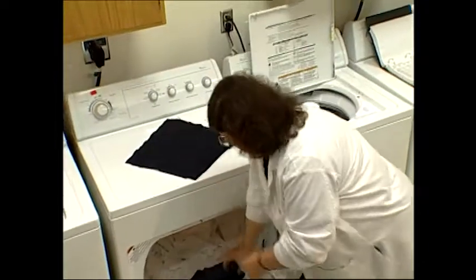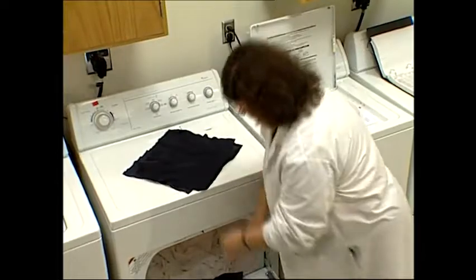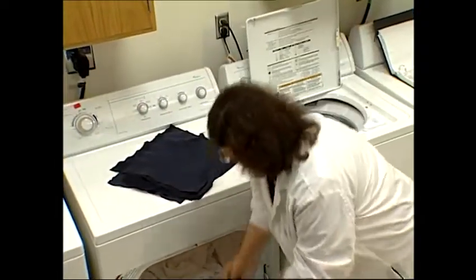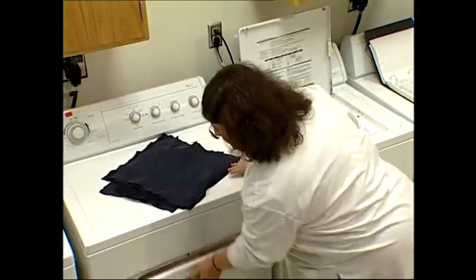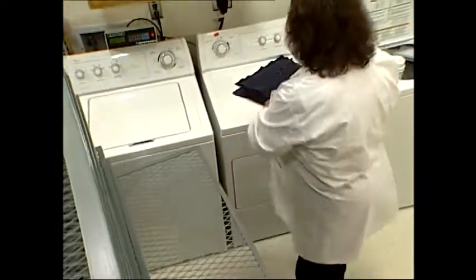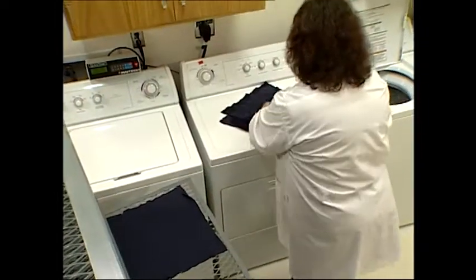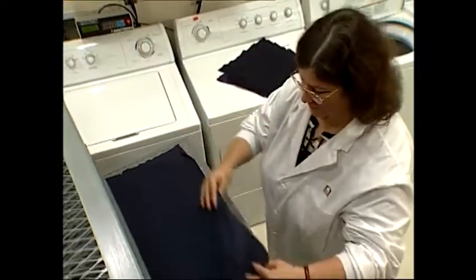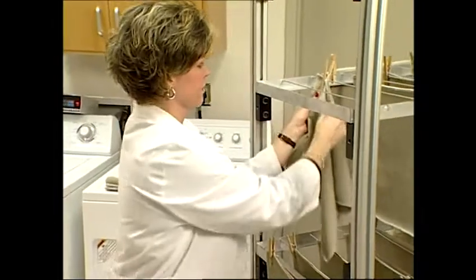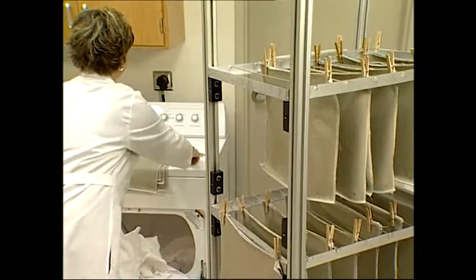One of the most important steps in measuring dimensional change is specimen handling following drying. Knitted and woven fabrics should be handled differently. Remove knitted specimens from the dryer after the final drying cycle and place them flat on a conditioning rack, as knitted fabrics are easily distorted. If knits are hung prior to measuring dimensional change, they will elongate in length, thereby falsifying the data. Remove woven specimens from the dryer and hang on the clotheslines of a portable cart, with the length direction of each specimen hung vertically.